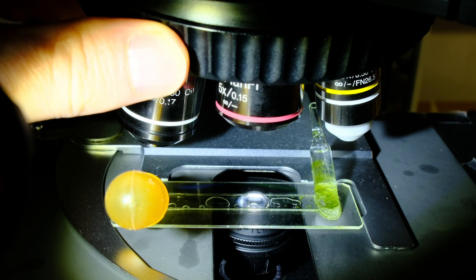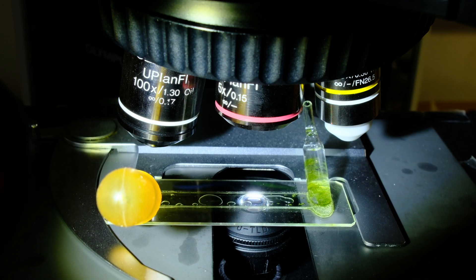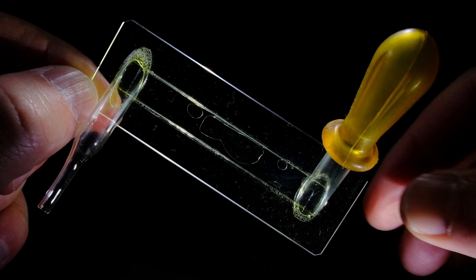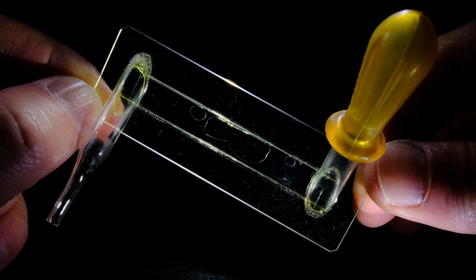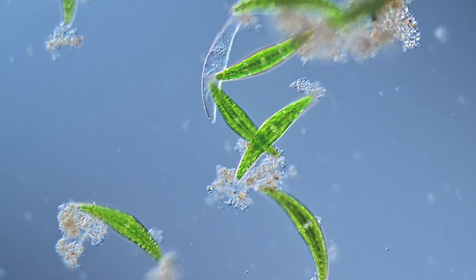Smaller lenses are no problem, though. But apart from these little inconveniences, the frankenpipette is an extremely useful piece of equipment. Even higher contrast modes like DIC or phase contrast are usable.